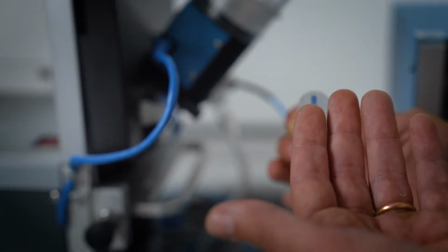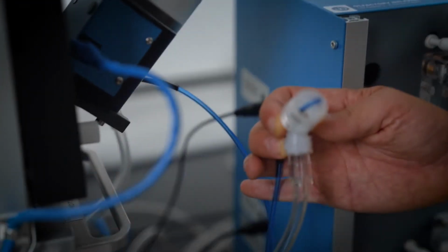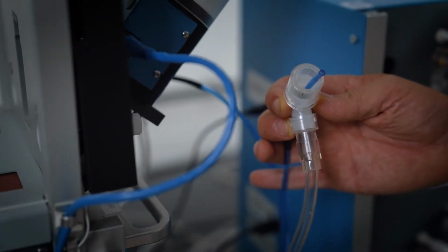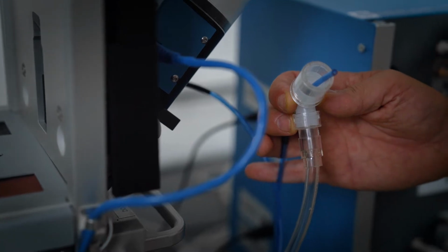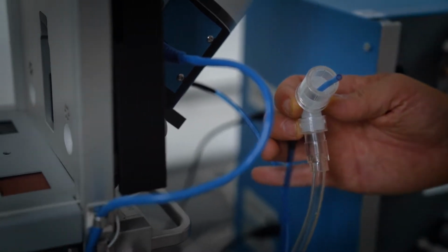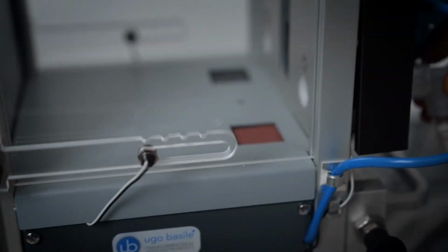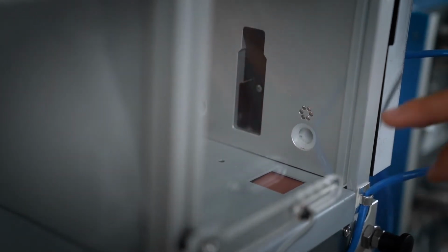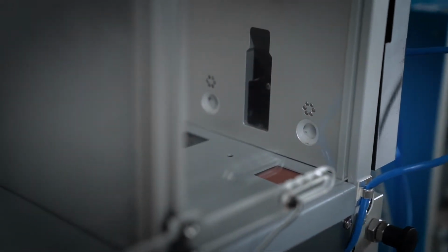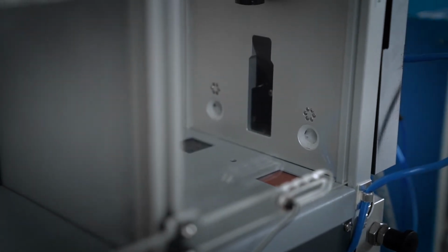So on one hand, the air is sent out, and on the other hand, the air with the odor is aspirated back, so that basically you can change the odor without having the odor in the chamber, but only in the nose poke. And this allows us to work on the dimension odor.